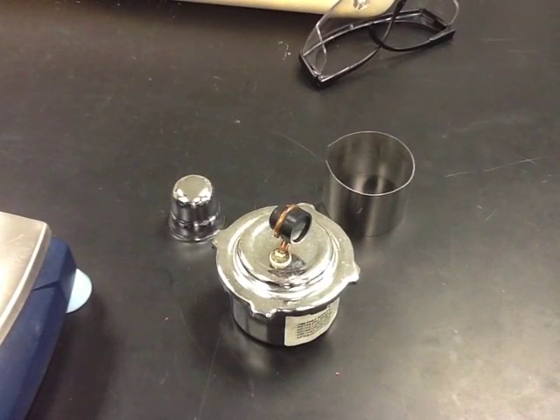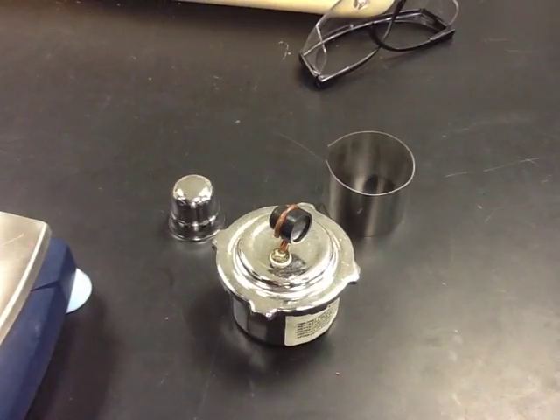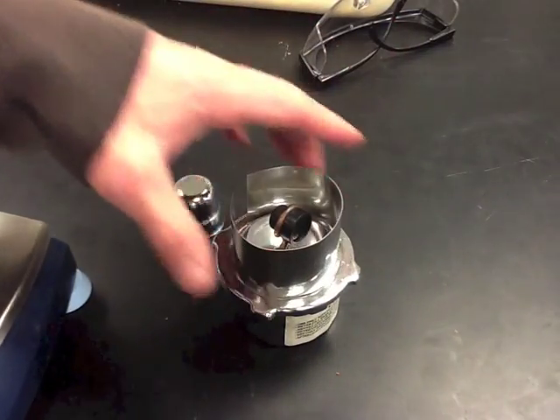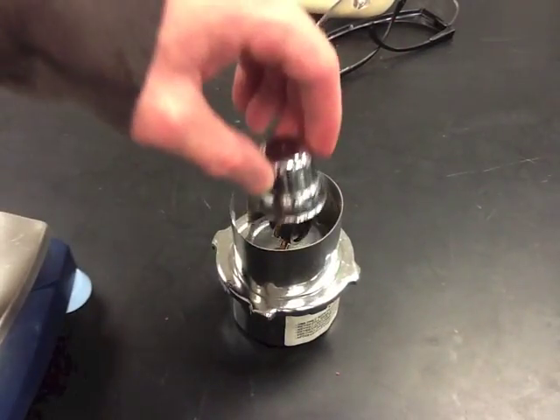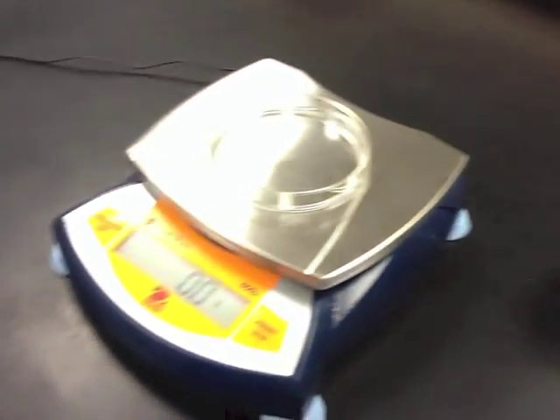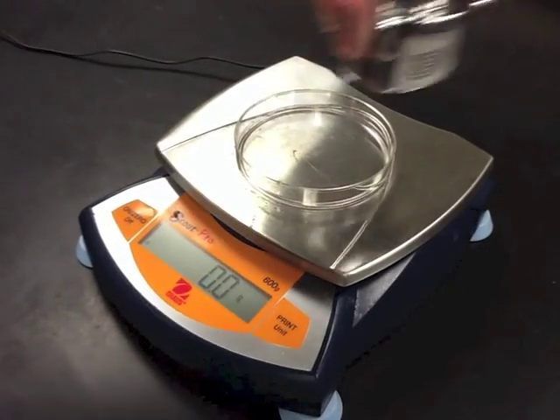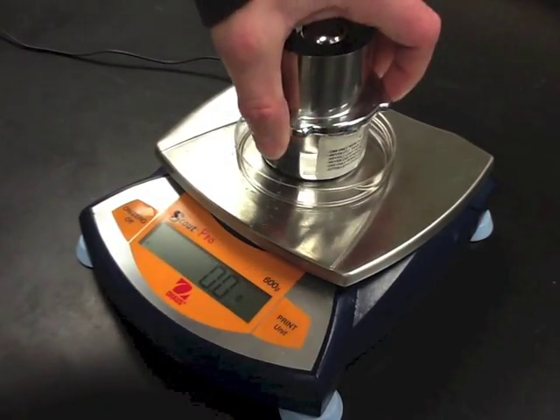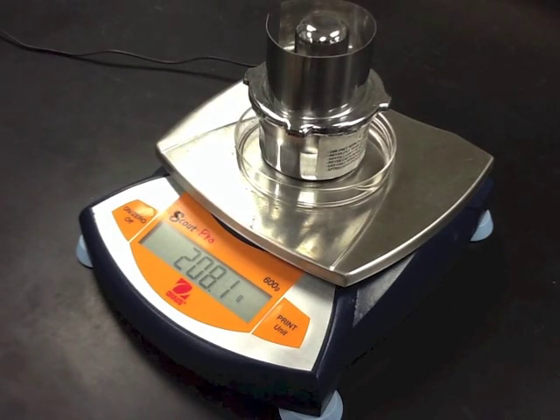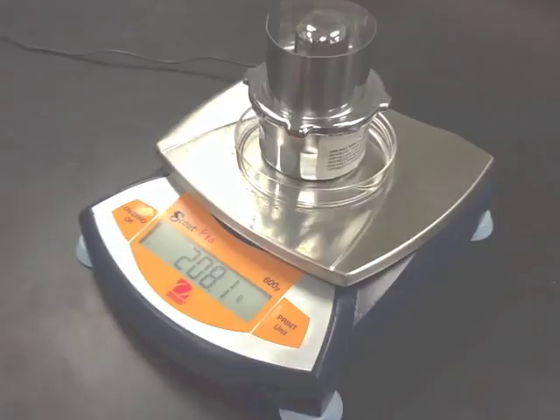When you weigh the alcohol burner with the alcohol in it, you can weigh it any way you want, but just weigh it the same before and after burning. So if you have all this stuff on it when you weigh it for the first time, make sure to include all that stuff when you weigh it the second time as well. Record that number in your data table.